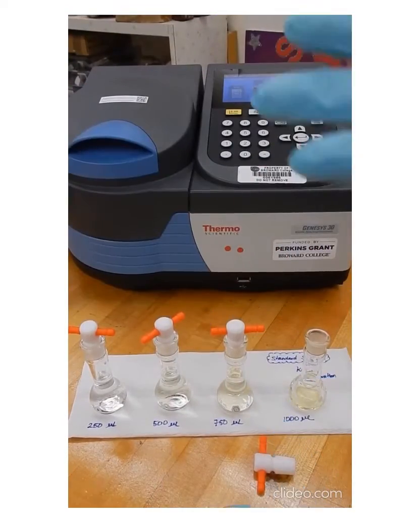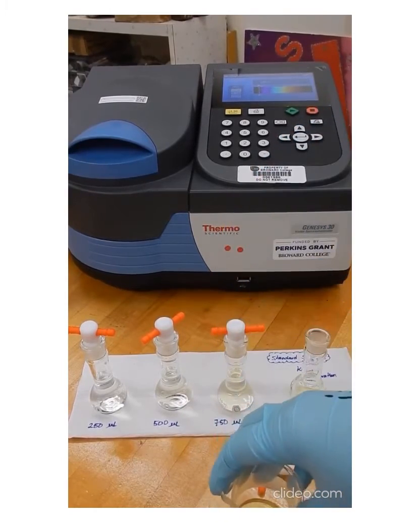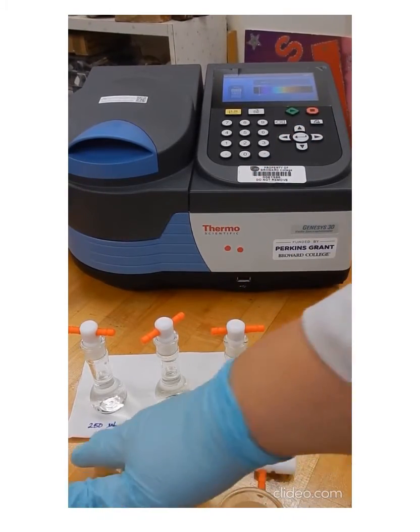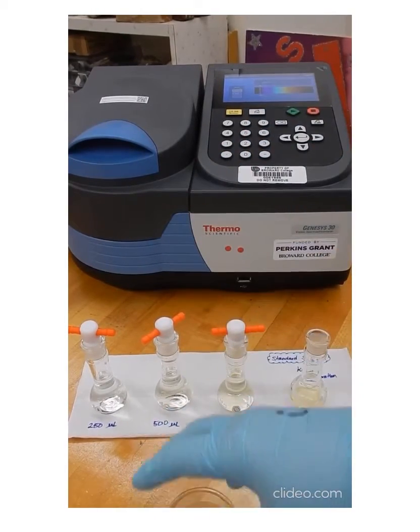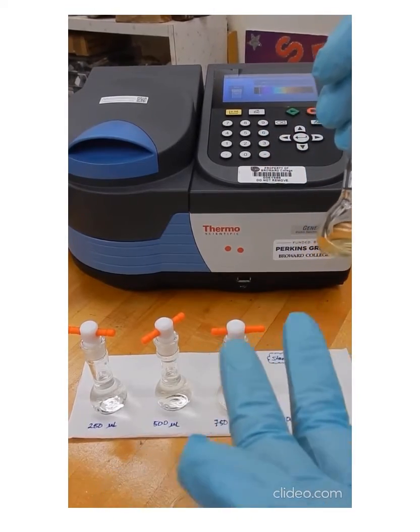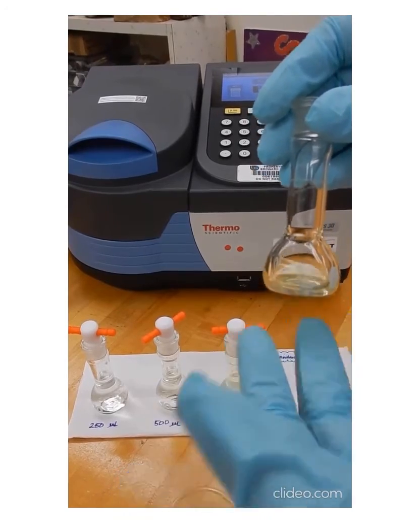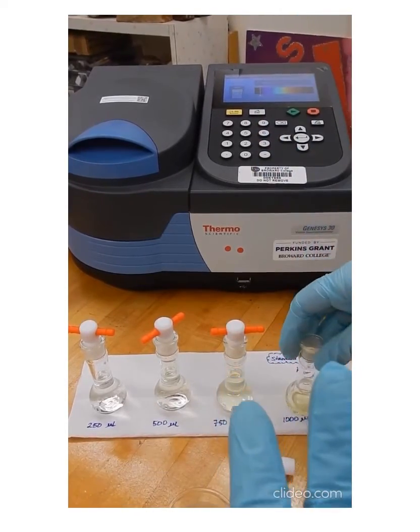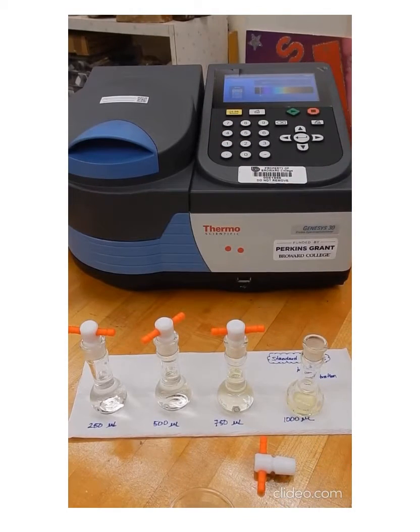preparing here, we need the concentration of your solution for potassium chromate. We need the volumes that we're using from our initial solution here, and we also need the final volume. With those 3 numbers, we can calculate the concentration of the final solution, which is the dilution. And we're using the dilution equation to find those concentrations.